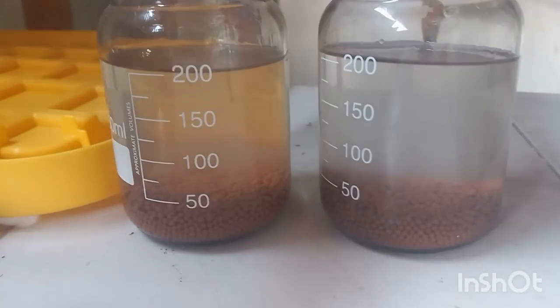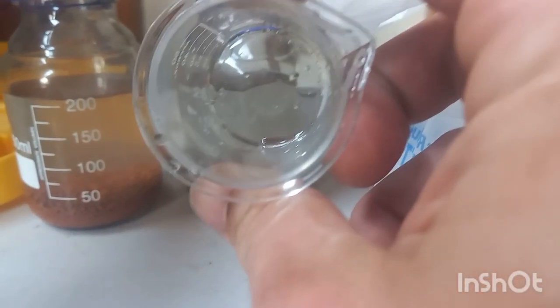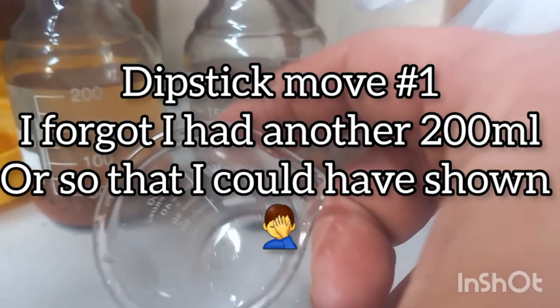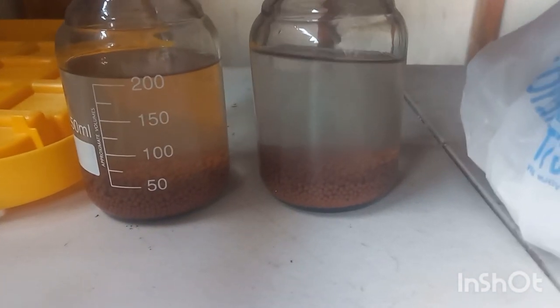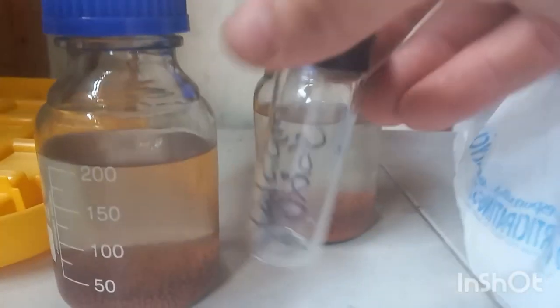Alright guys, sorry, I accidentally put the propylene carbonate in before I got to record it, but down here, this oily substance is propylene carbonate, and I've dumped it into the methanol. We have the molecular sieves that will dehydrate this as much as possible. Dumping it in, I noticed the dissolution of propylene carbonate in methanol is endothermic, so it got a bit cooler. So anyways, now off to make the calcium oxide.